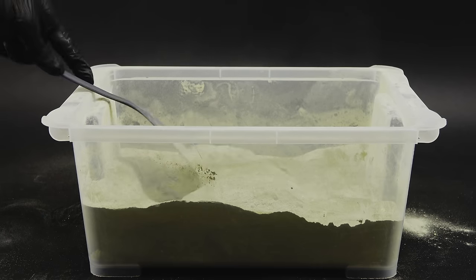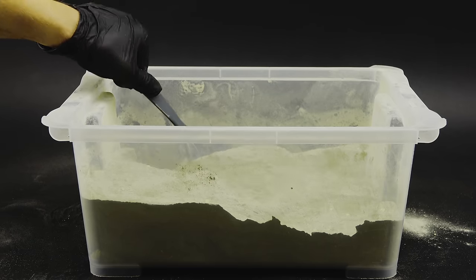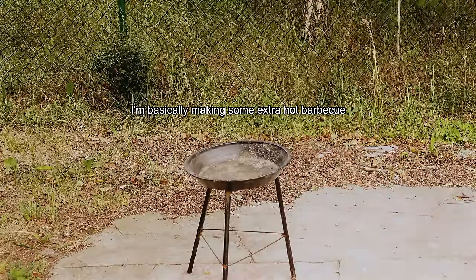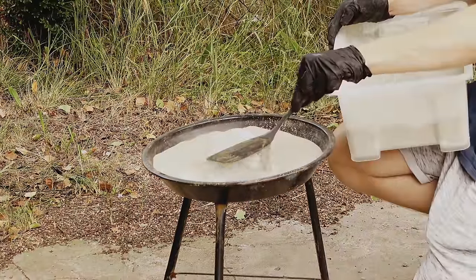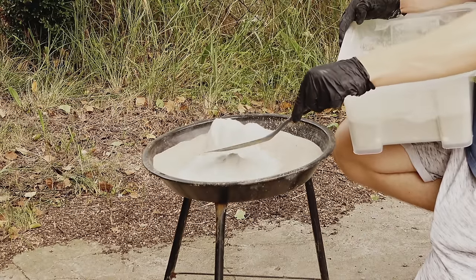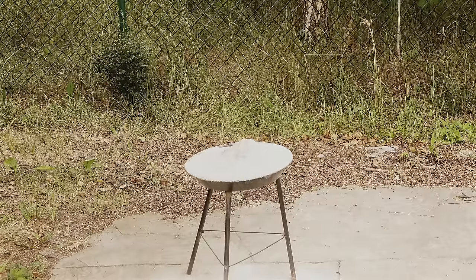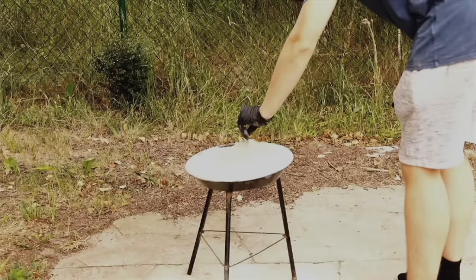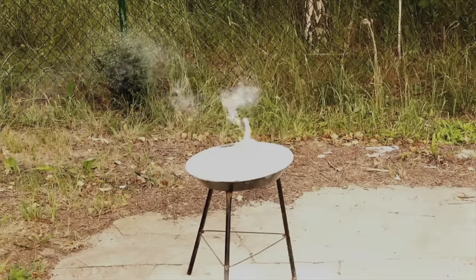Now it's time to light this thing up and finally make some silicon. I couldn't do it inside for reasons that will become clear later, so I again got outside to the place of doom. I decided to ignite the thermite in this old grill. I was afraid it would melt through it, so I used one of the previously made bottles of sand to make a comfy thermite bed. When it was ready, I started making a big mountain of the thermite mix using my spatula, and in the end decided to just dump it all in. To light it, I placed a small shaving of magnesium metal on top of the thermite mountain like a flag, and then proceeded to ignite it using my blowtorch — it served as a fuse, allowing me to safely run away.